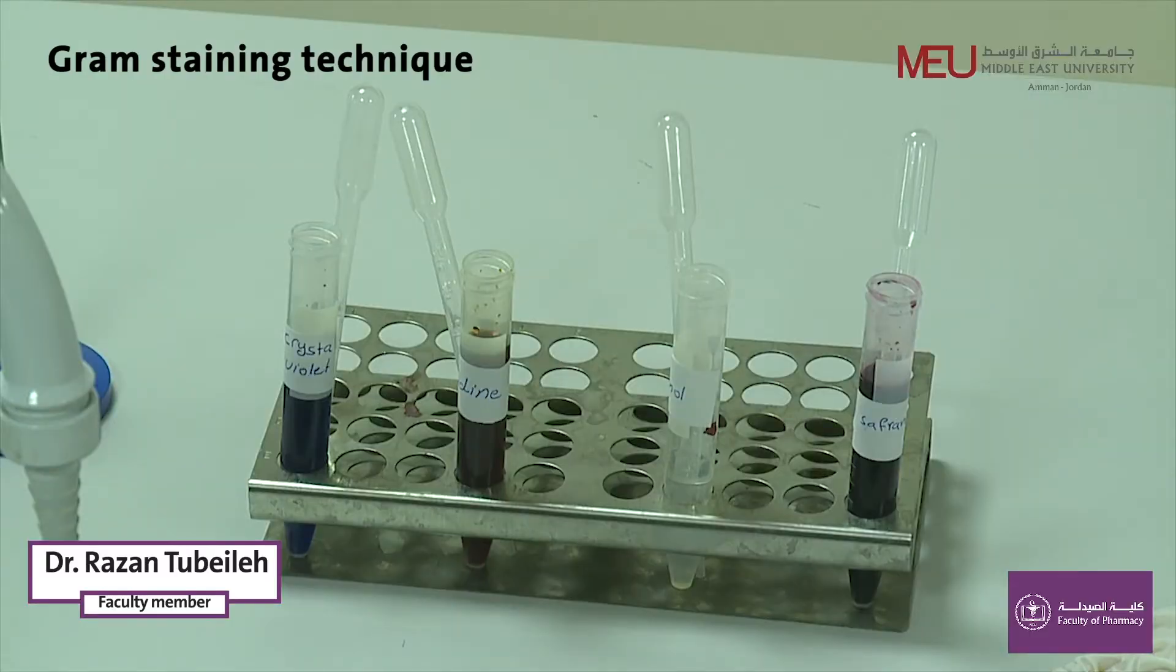Dear students, welcome to the microbiology lab. Today our experiment involves performing gram staining technique.